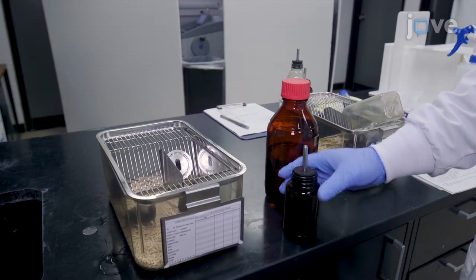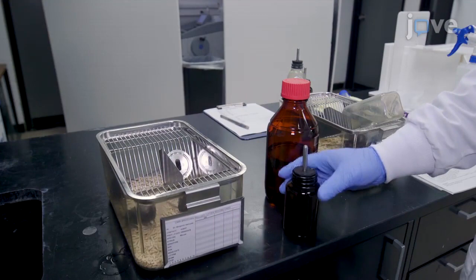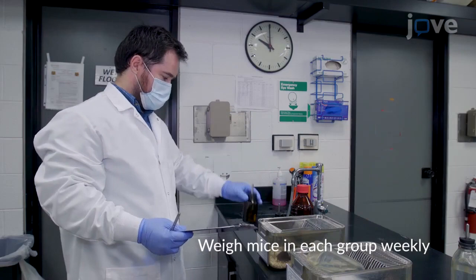Then fill the water bottles of the vehicle and corticosterone mouse group with the appropriate solutions and record the volume of liquid consumed twice a week.